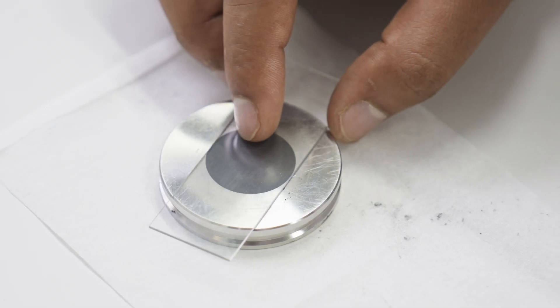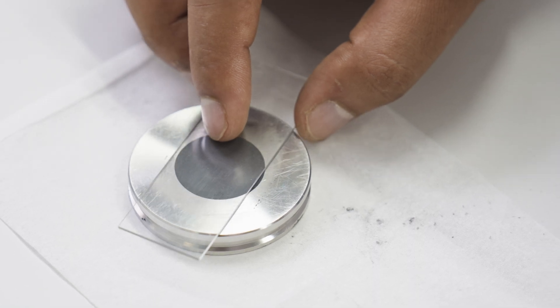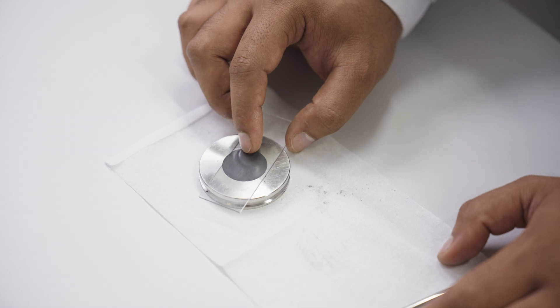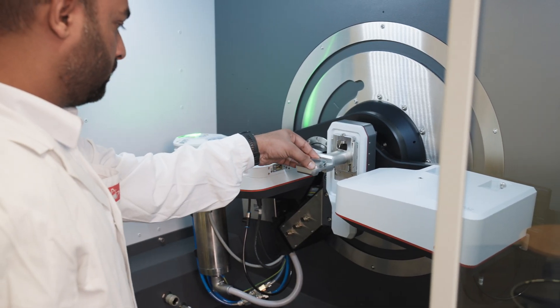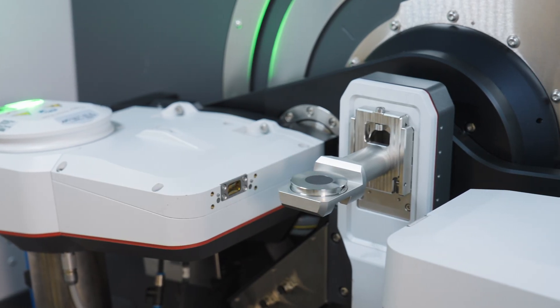Carefully fill in the powder, then gently tap it and flatten it with a glass slide to make sure it is completely flat, in order to avoid errors during X-ray diffraction analysis. Then place it on the sample stage in the XRD instrument.